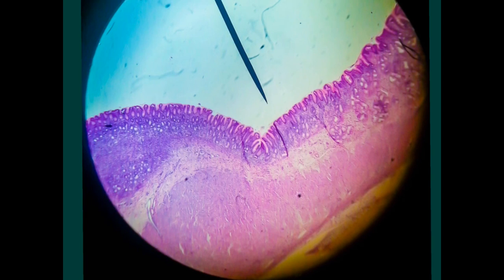Okay, so here we have villi and crypts actually, and here we have the pits, but as a first look, all the epithelium is showing these white striations, and at one side you will see the mucus glands of the Brunner's, and on the other you will see the muscle of the pyloric sphincter. No stratified squamous epithelium all over this epithelium, so this is the pyloroduodenal junction.